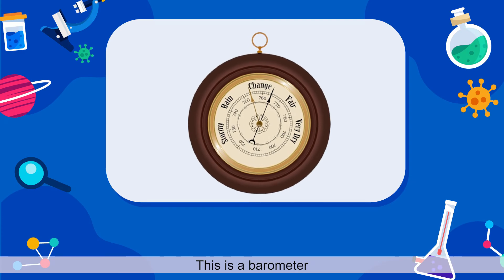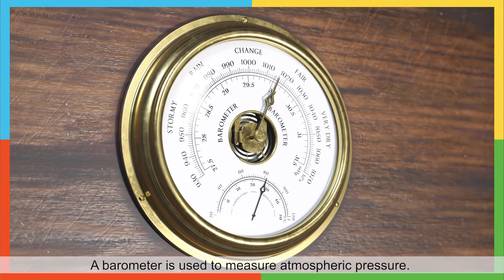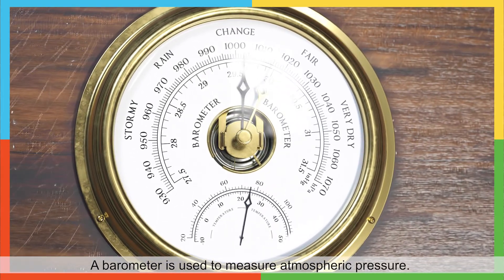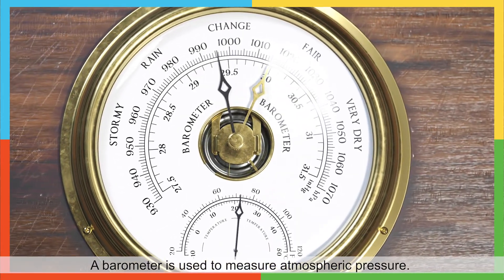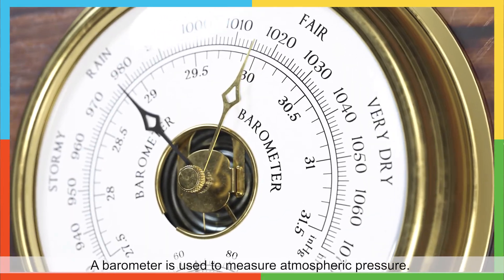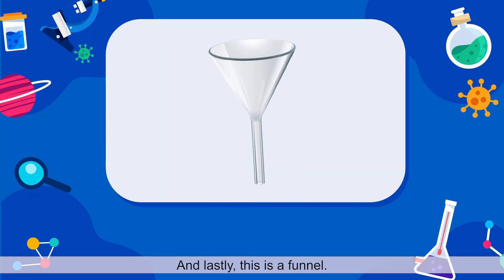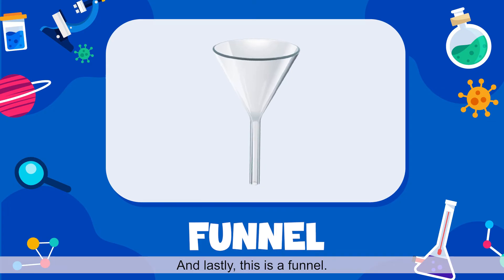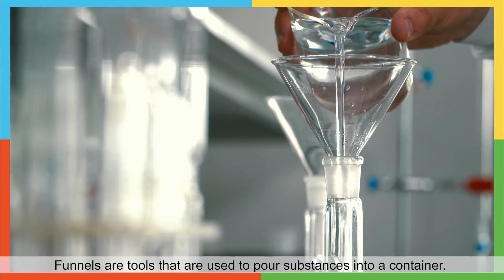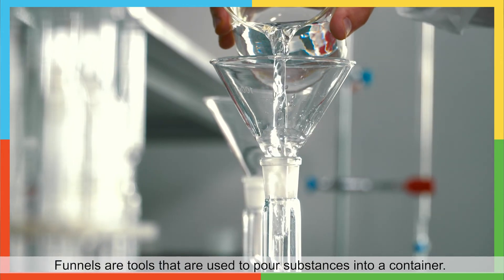This is a barometer. Funnels are tools that are used to pour substances into a container.